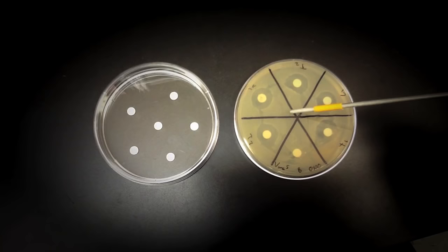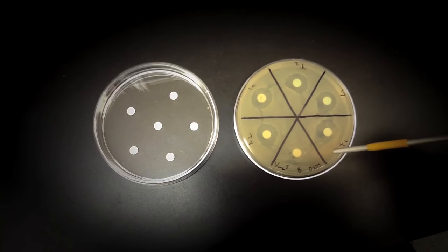For this test, we'll use a known strain of bacteria to make sure a specific amount of antibiotic is giving us the correct zone of inhibition. Let's get started.